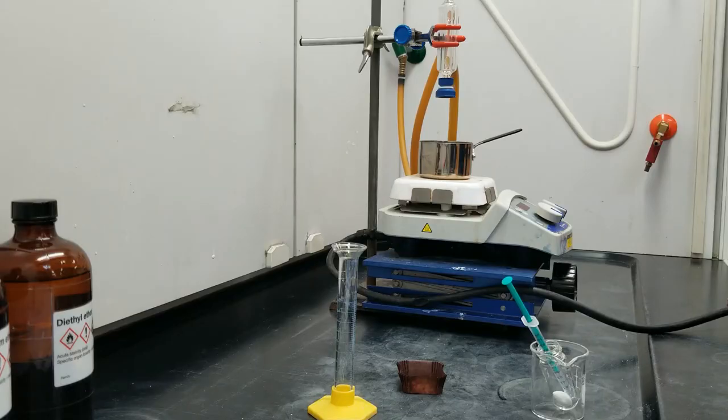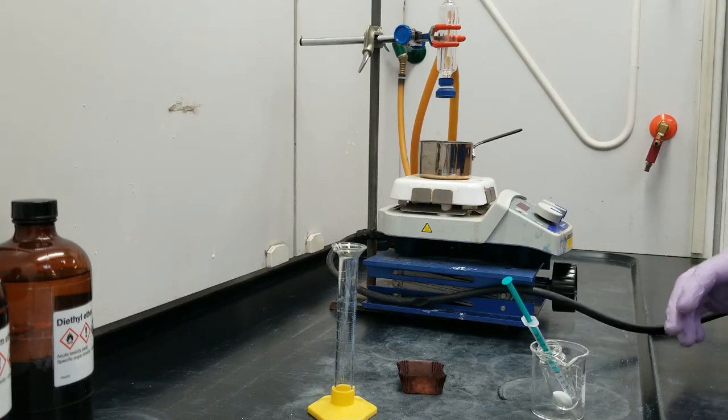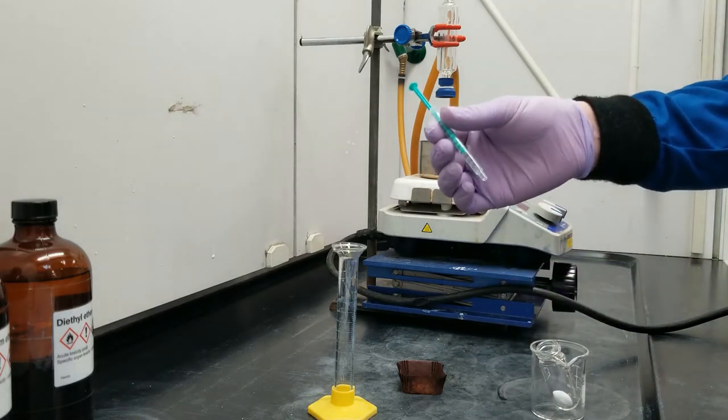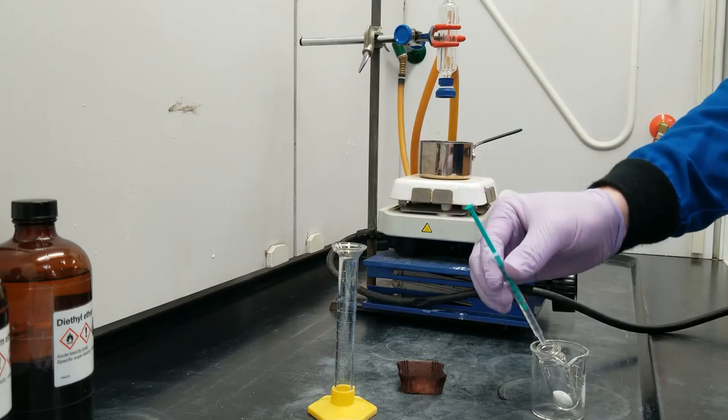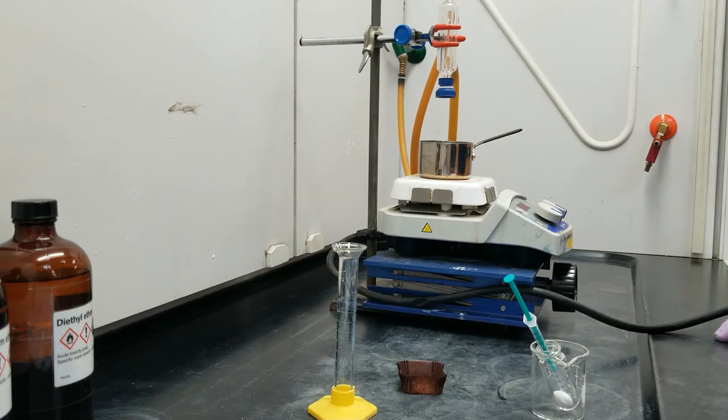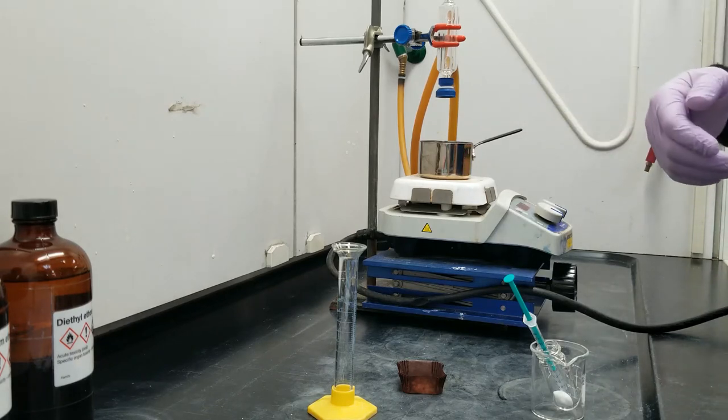The Diels-Alder reaction of a diene found in eucalyptus oil. In this lab, the purpose is to take a half milliliter of eucalyptus oil, which I have in a syringe here, and within that eucalyptus oil is a diene, a mystery diene, and we're going to figure out what it is and how much of it there is. The way we're going to do this is by forming an adduct, or a product that we can easily remove out of the solution and analyze.